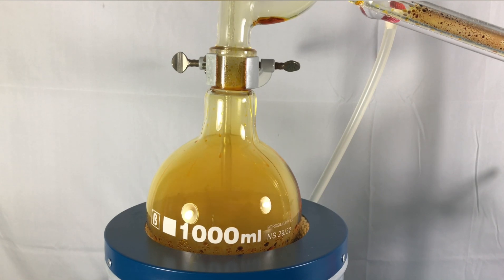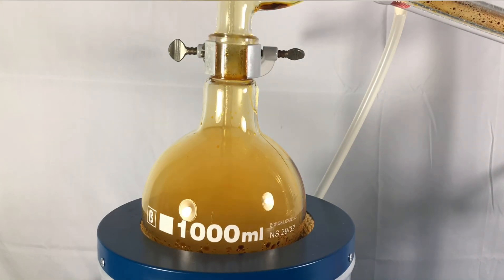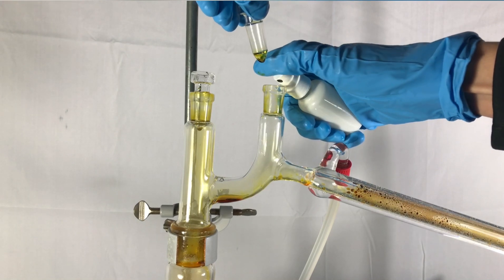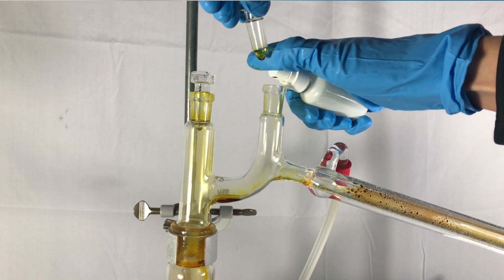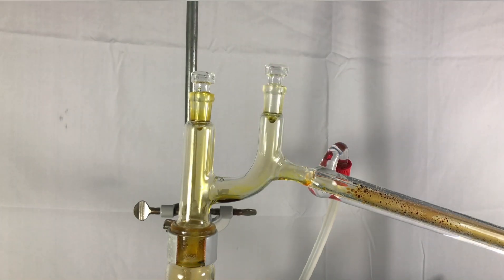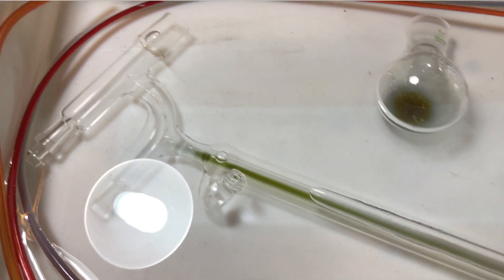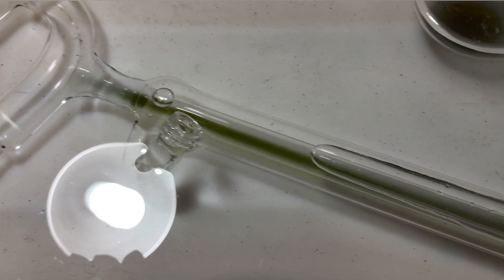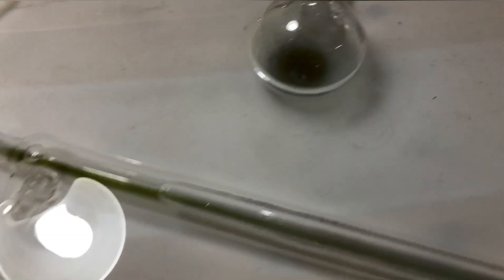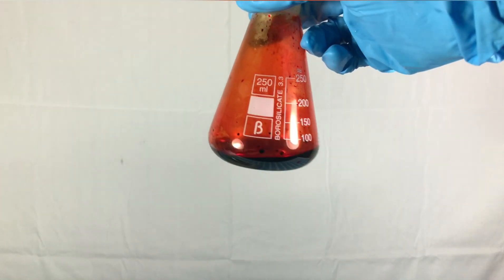At some moment I hope that this effect finally stopped. Unfortunately it didn't. It continued for 20 more minutes. Before disassembling the apparatus I took this spraying bottle and sprayed a lot of ascorbic acid solution in there. This should already eliminate a lot of hexavalent chromium in the distillation bridge. After we are finished everything was placed into the reducing bath. Here you can see the green color of chromium 3. Chromium 3 plus ions are a lot safer to handle than any hexavalent chromium.